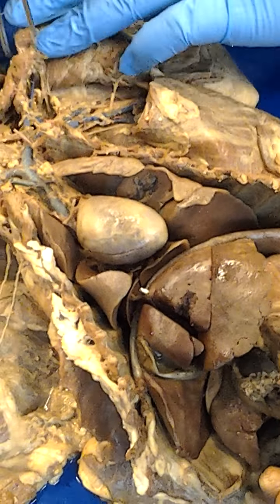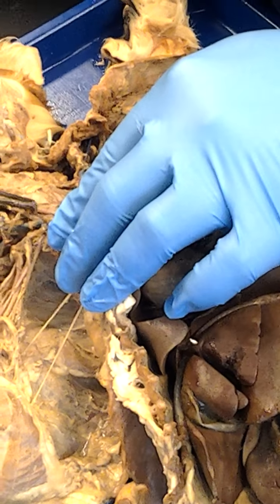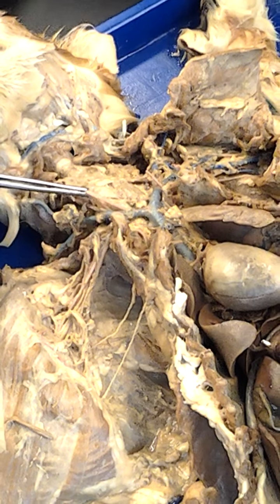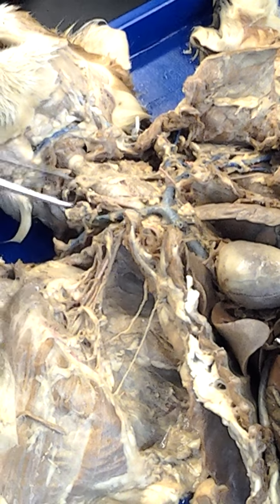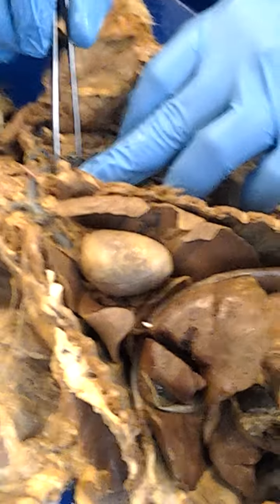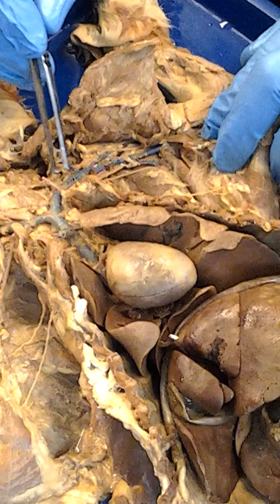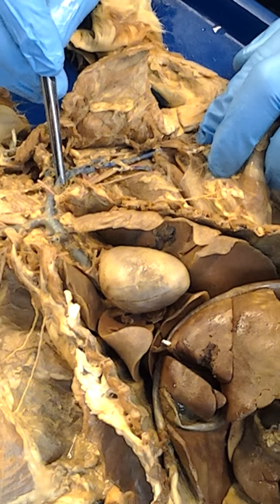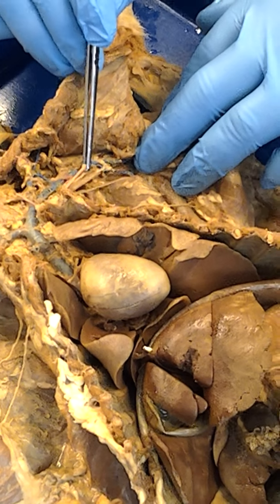Now if we go back this way and head it back over on this side, we'll see that there's a red blood vessel right here. This, of course, is the carotid right there. So that's the carotid, which is an artery. And we head back this way towards the arm. Notice that here we actually have the subclavian, starting here, subclavian artery, and, of course, the subclavian vein right there. And then as we head this way into the armpit, we have, of course, the axillary right here.